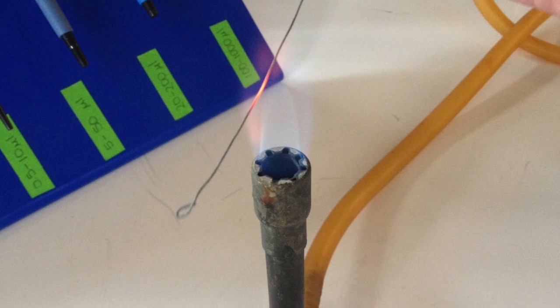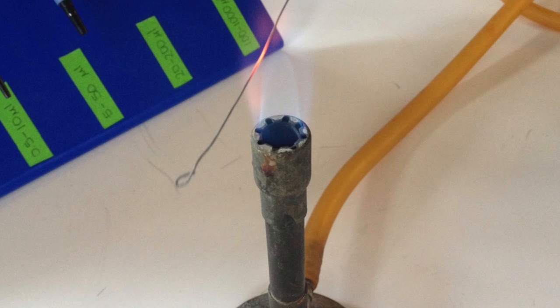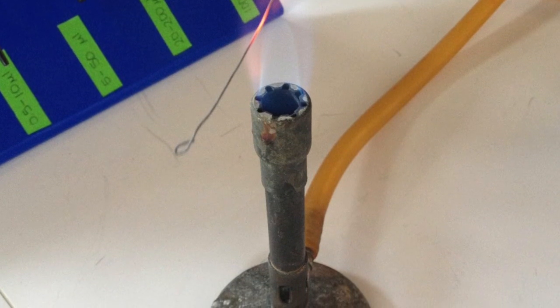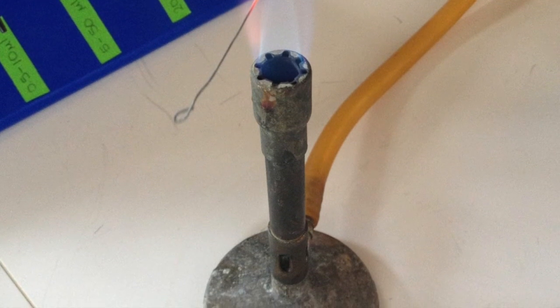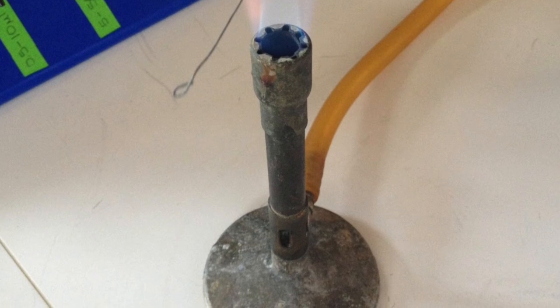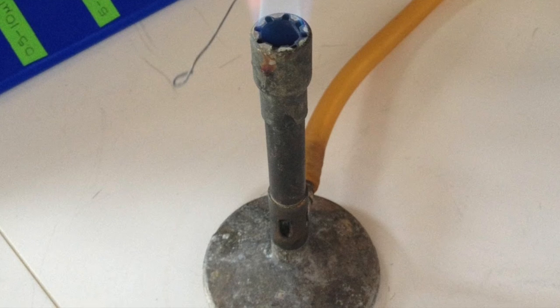For the gelatin hydrolysis test, we acquired a test tube filled with nutrient gelatin. Then, using sterile technique, we inoculated the needle with our bacteria through the gelatin. We then incubated at 30 degrees Celsius for 48 hours. After incubation, it had to sit at room temperature for 30 minutes to see if the gelatin liquefied or solidified.